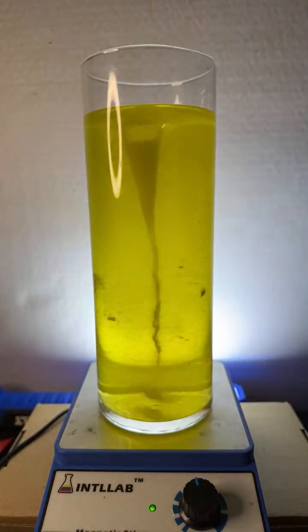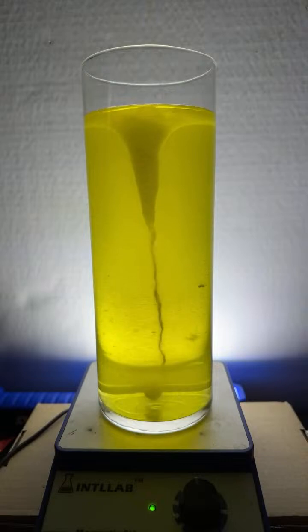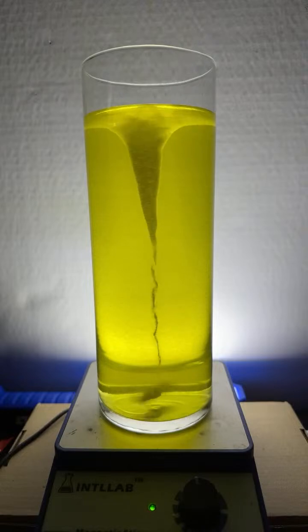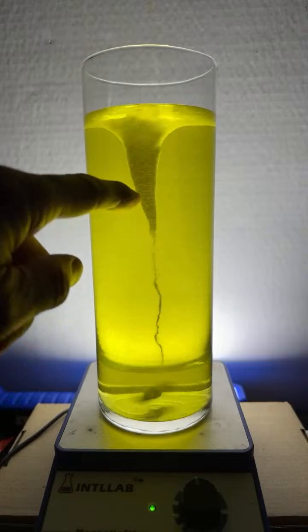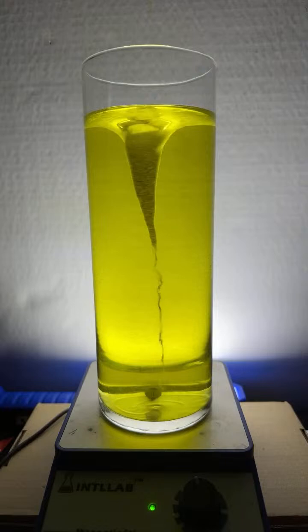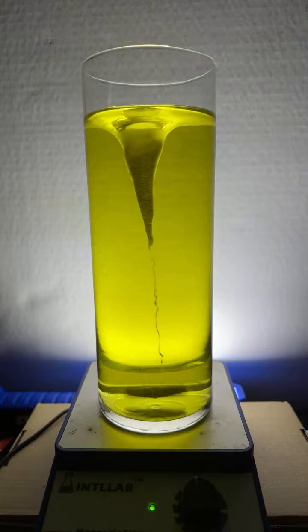It's just slightly acidic. And what I want you to notice is the bubbles that are produced from the Alka-Seltzer tablet. That happens from the reaction between citric acid and sodium bicarbonate in the Alka-Seltzer tablet. And all that carbon dioxide that's produced, it's kind of interesting how the bubbles end up in the funnel. I don't know if you can see that, but the funnel used to be kind of transparent. Now it's cloudy because there's all those bubbles in there. And now I'm going to add some sodium hydroxide to the funnel. And sodium hydroxide reacts with carbon dioxide.